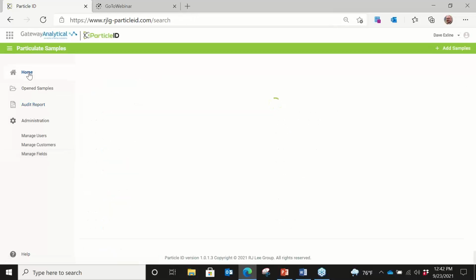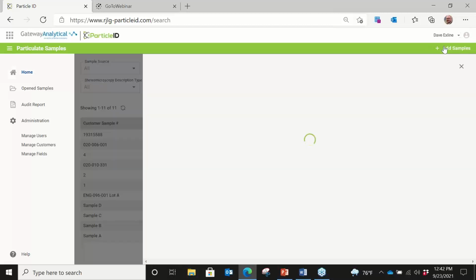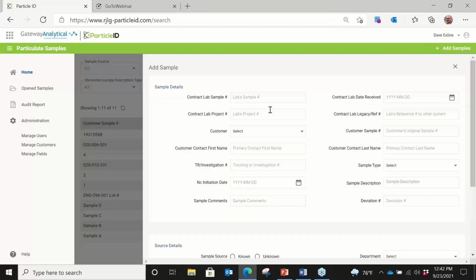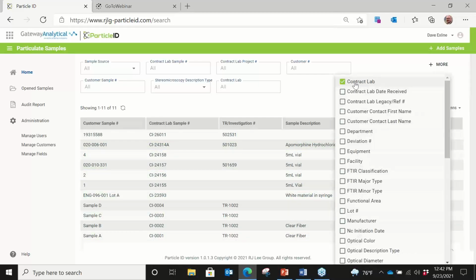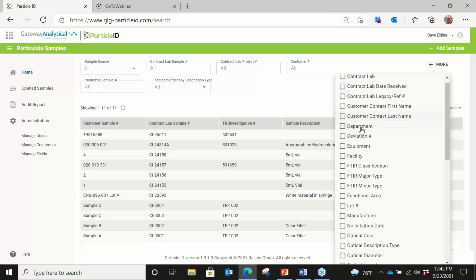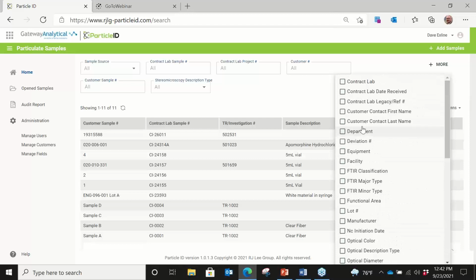So if we go back to the home page, I can show you how to add a sample. You simply click the add sample button, and this is all the information that you would type in, and this would be fed into the database. So this is where essentially we would put all the information for adding a sample in. And from a searchability standpoint, in this particular example, there are about 6 classifications here that are just showing what I can search on, and then it would filter each of these. I can add or subtract whatever I want to sort on by selecting any of the classifications that are related to the sample. So that's a really nice function.